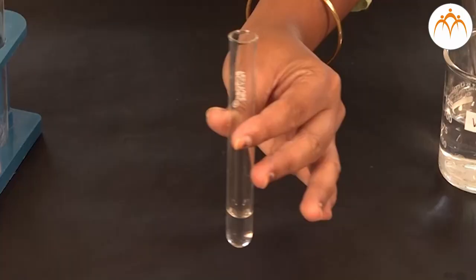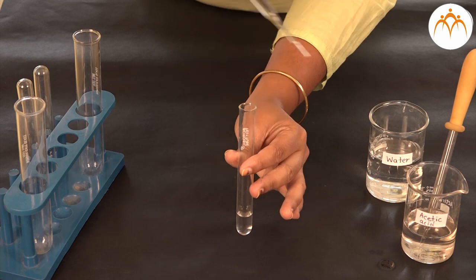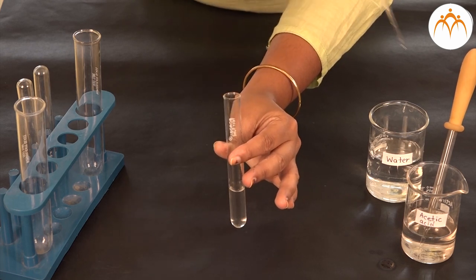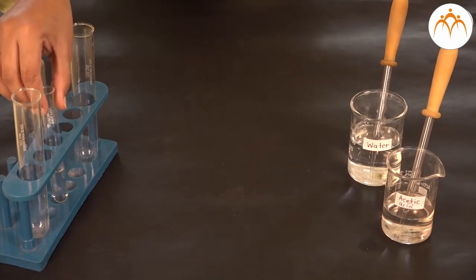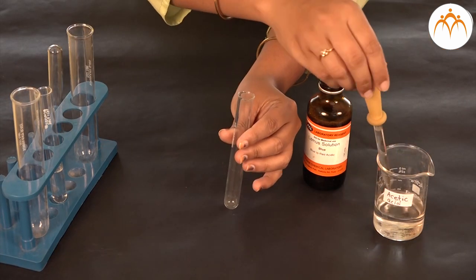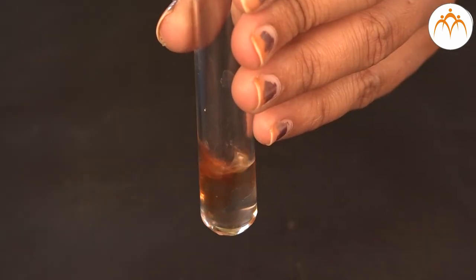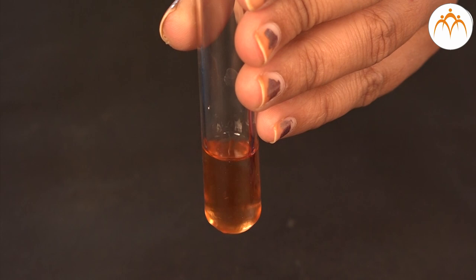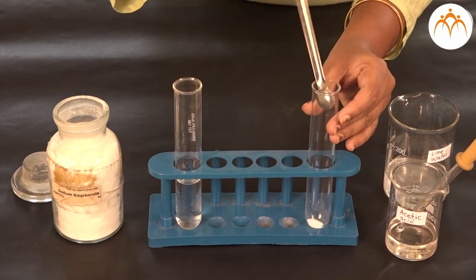Take two to three ml of acetic acid in a clean, dry test tube. Note its color and smell or odor. Add four to five ml of water to the test tube and dilute the acid to use for various tests. Perform litmus solution tests in two separate test tubes — add red and blue litmus solutions to the diluted acetic acid and note the color change.